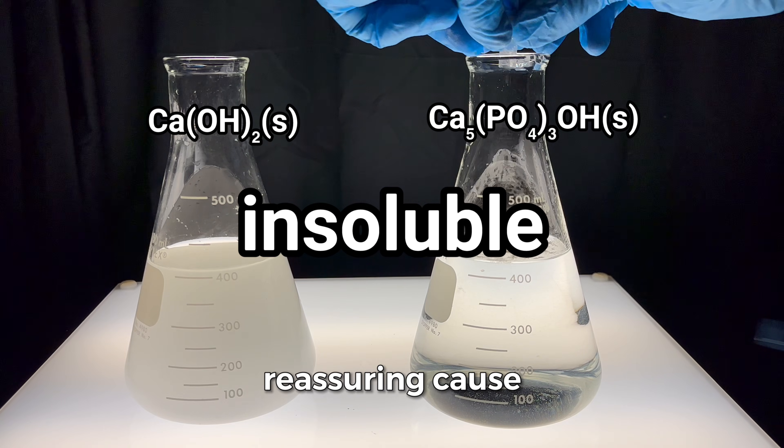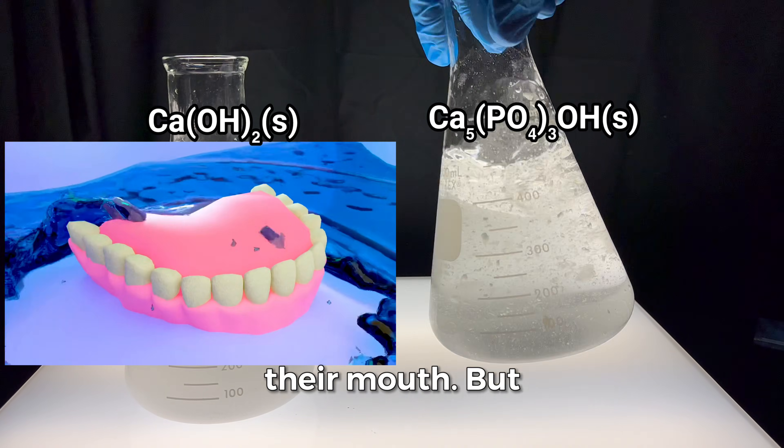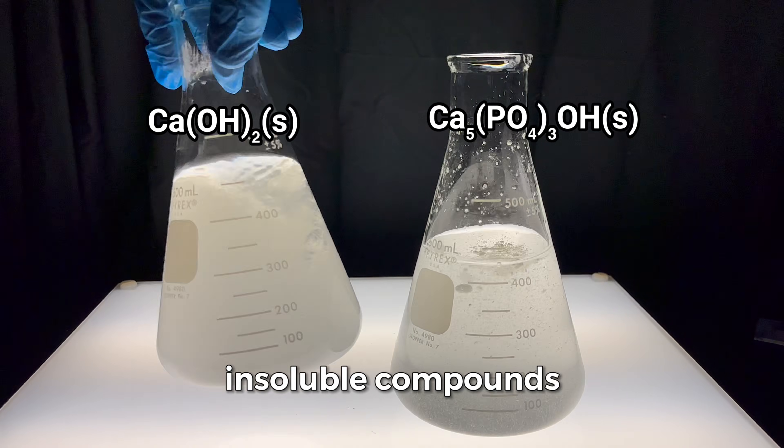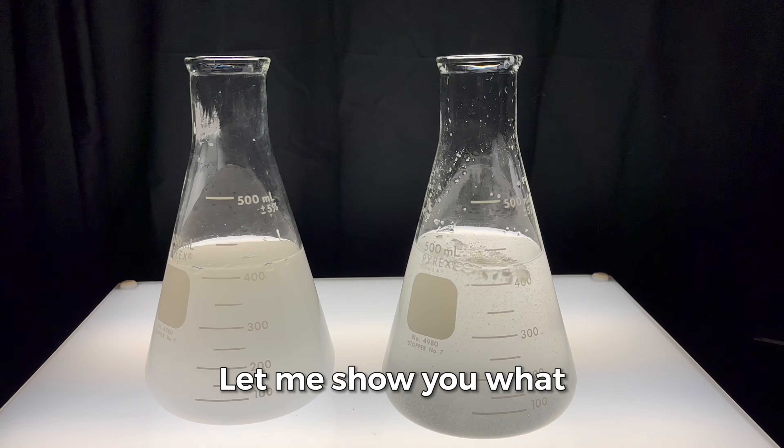And honestly, that's reassuring because nobody wants their teeth dissolving in their mouth. But there's a subtlety here because even insoluble compounds dissolve a little bit. Let me show you what I mean.